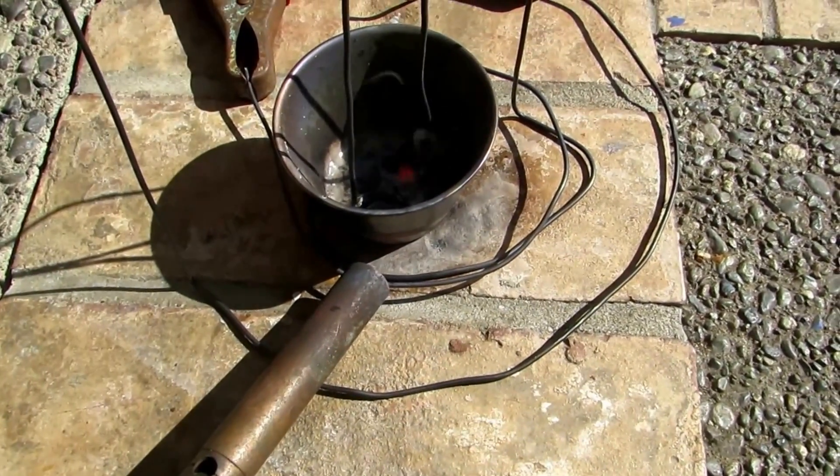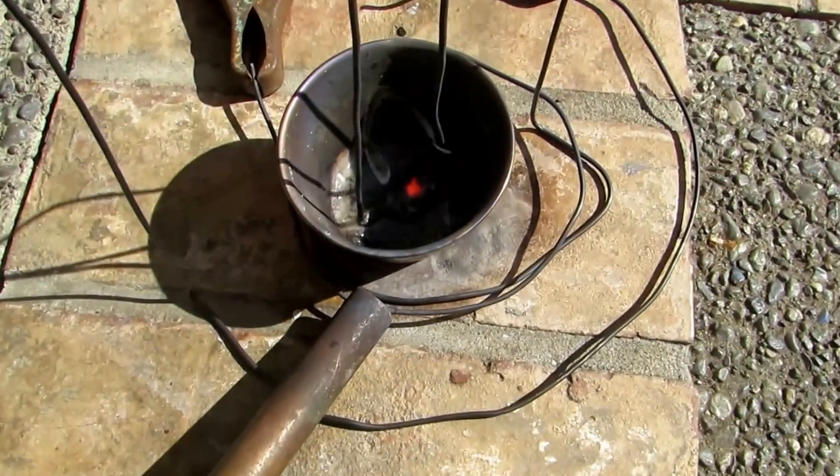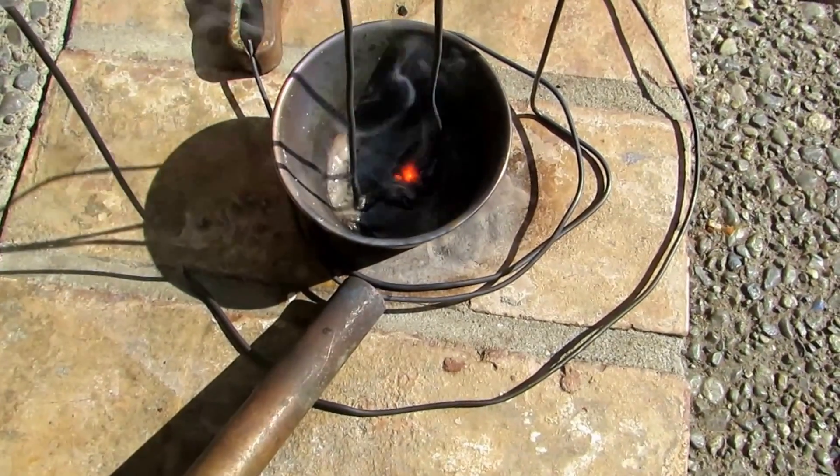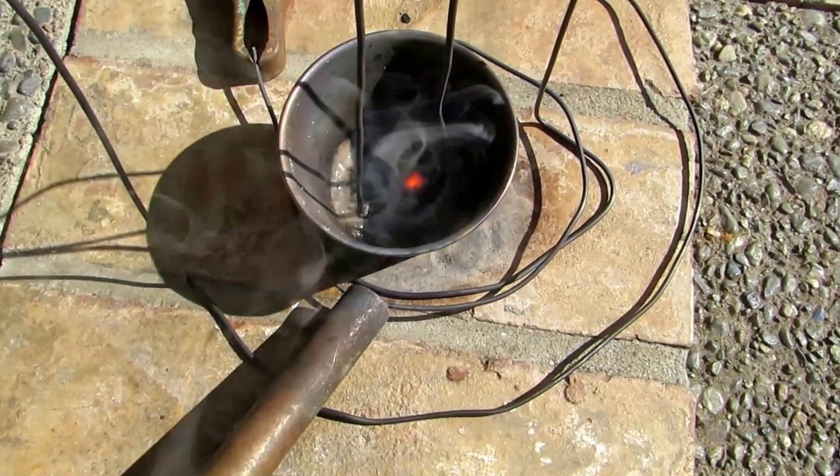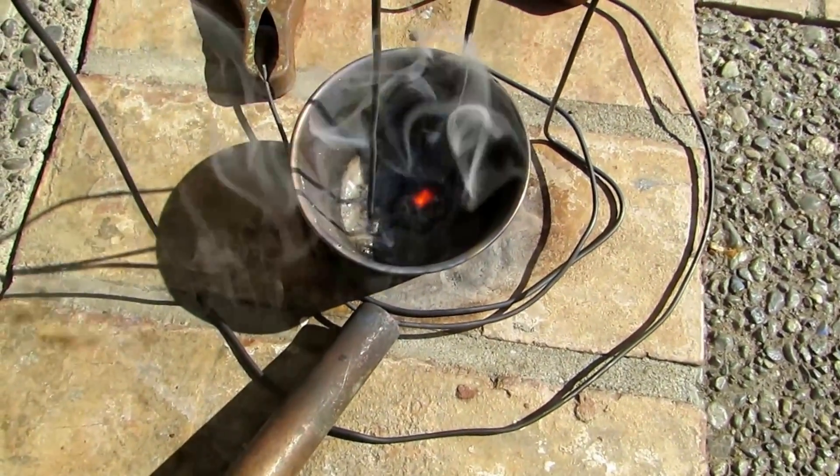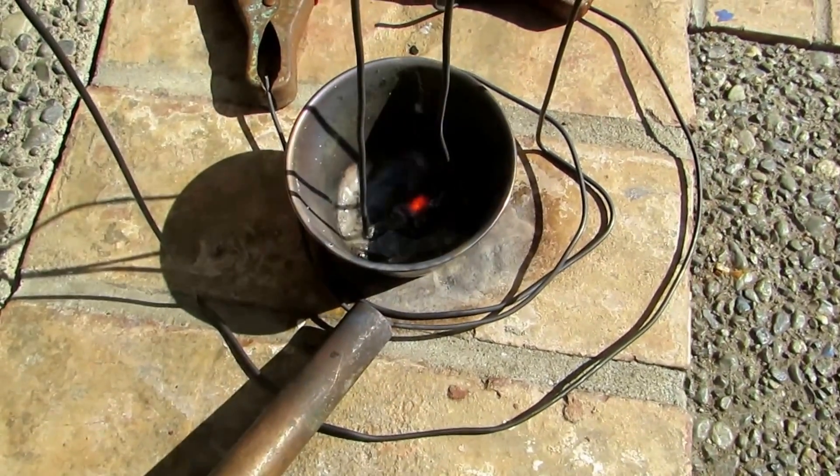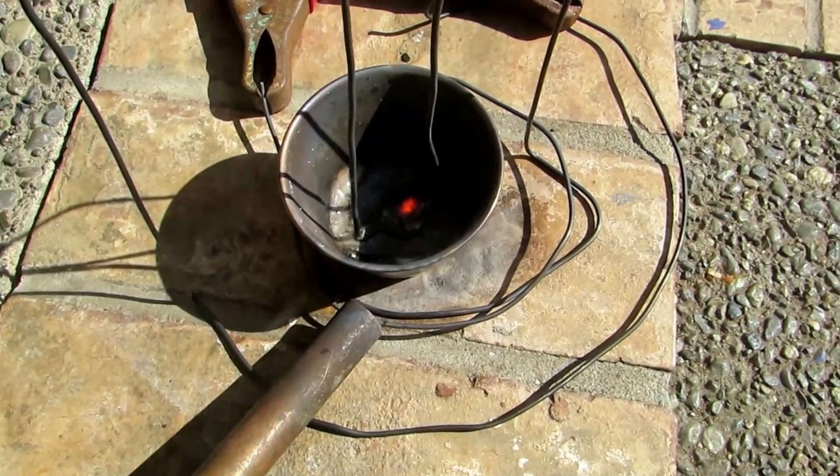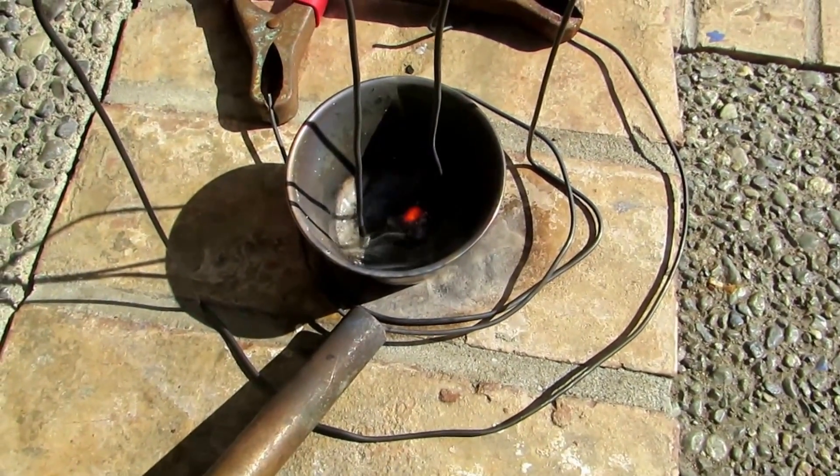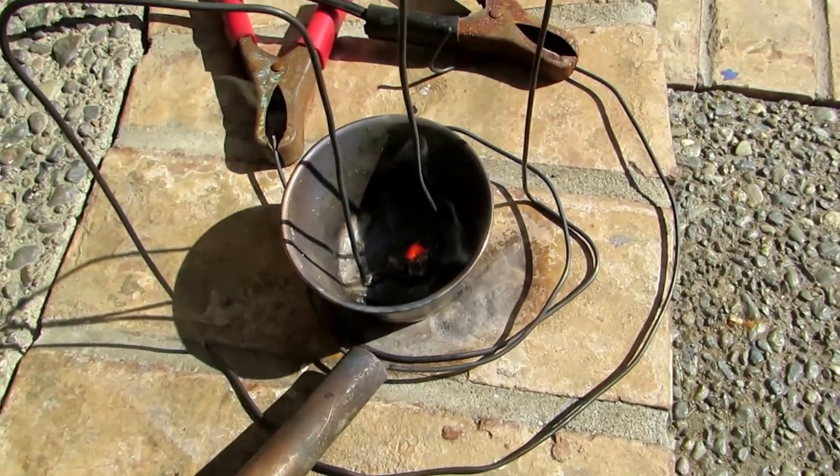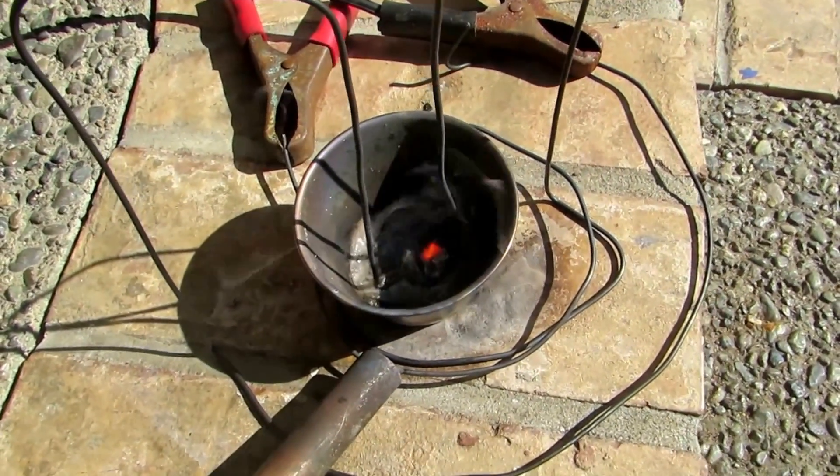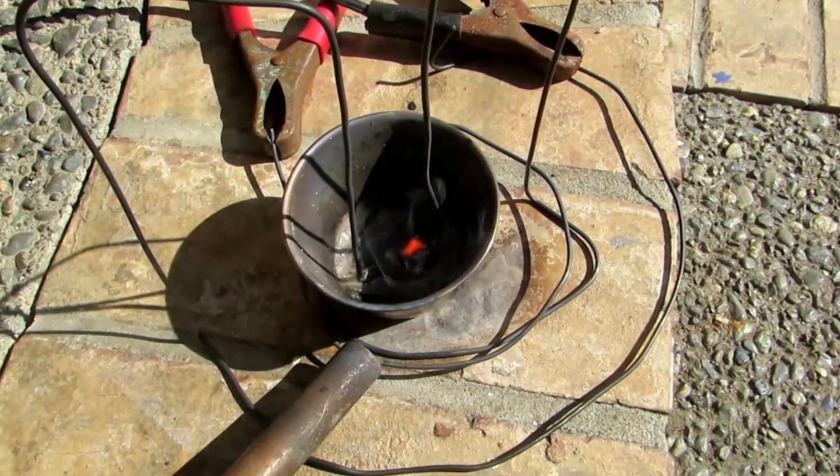Okay, so as you can see, it's heated up to a liquid. And there's a little glowing down in the center where the electrolysis has happened and a couple of flashes every now and then. So we are producing strontium metal. And it is just combusting in the air so rapidly because it's exposed to the air and it's really hot. So I'm hoping that I'm going to get some strontium out of this and I'll show you the results when we're done.